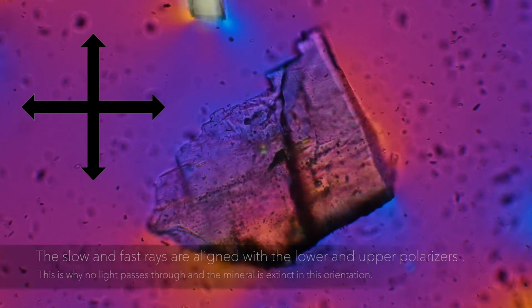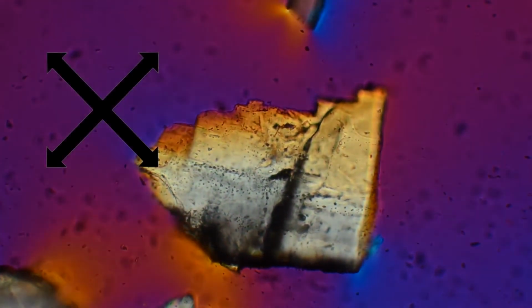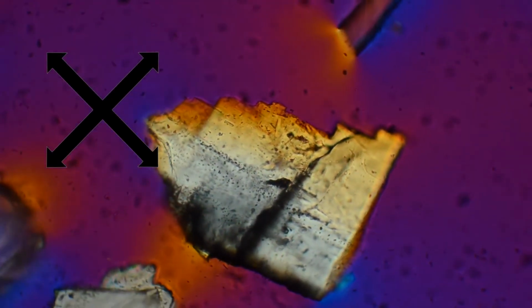I rotate the stage another 45 degrees to the next maximum illumination position where the slow and fast rays are at 45 degrees from the polarizer directions. Here, our mineral is displaying first-order interference colors. One of these maximum illumination positions is where our fast ray is propagating, and one of these positions is where our slow ray is propagating. Let's look at each position separately.